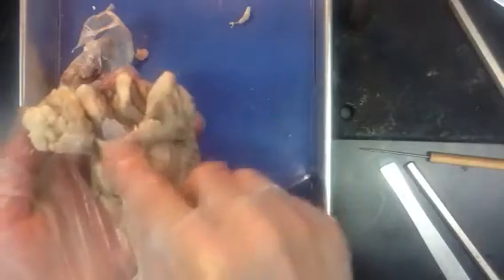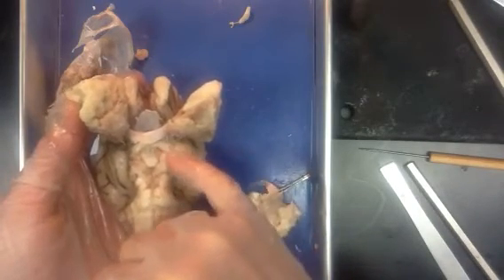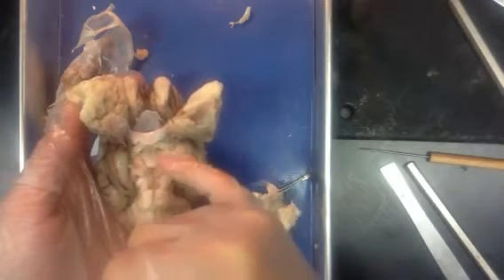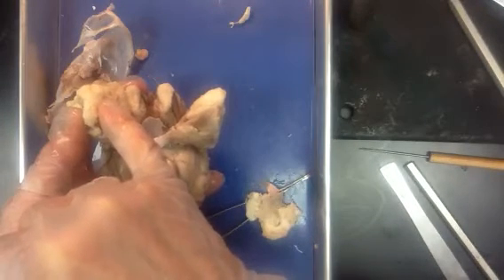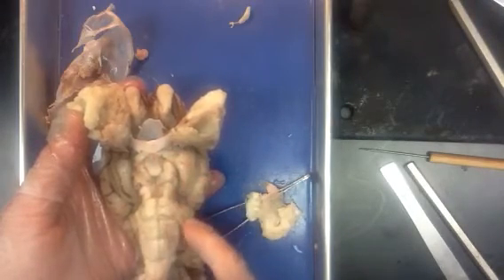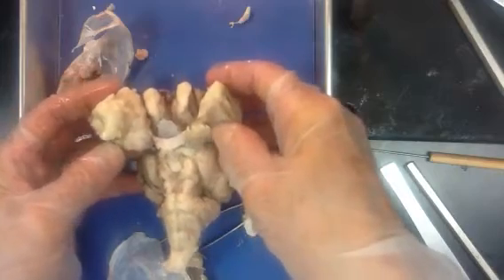They have good vision. What you'll notice with optic nerves is that they have an area where they cross. It makes an X, which we refer to as the optic chiasma. The letter X in the Greek alphabet is referred to as chi. Some people say chi. I learned it as the chiasma. So you see this X marks the spot, and that brings information from this right eye back to the right side of the brain and also to the left side of the brain. So it can crisscross both of those, and that helps with not only 3D vision but general visual interpretation.